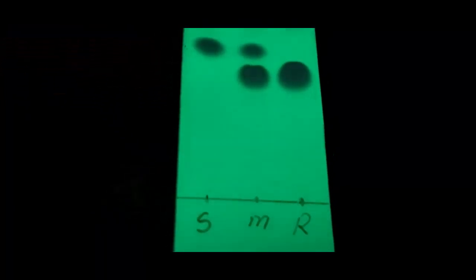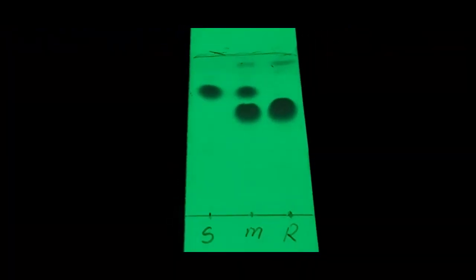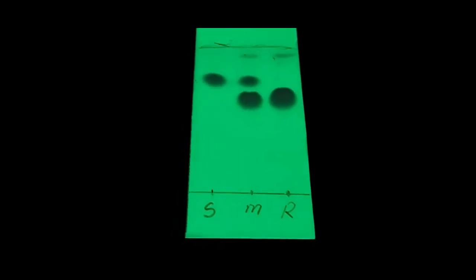Excellent TLC result! We have the starting material spot visible here, and in the mixture lane the same spot appears. We also have a new spot corresponding to the final product. There is a large spot for the final product and nothing remaining for the starting material, meaning the reaction is completely finished. I will take a picture and send you the TLC to calculate the Rf values and include them in the report.